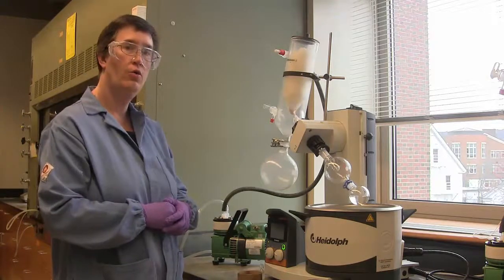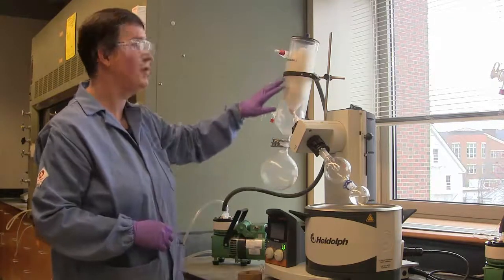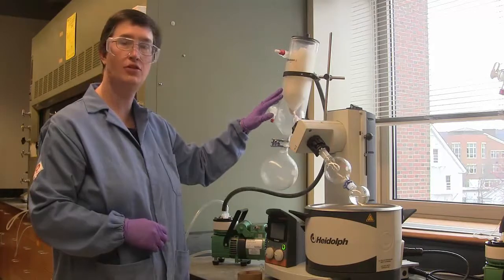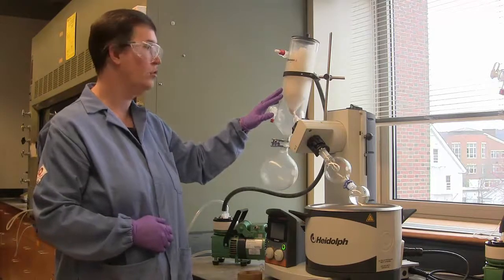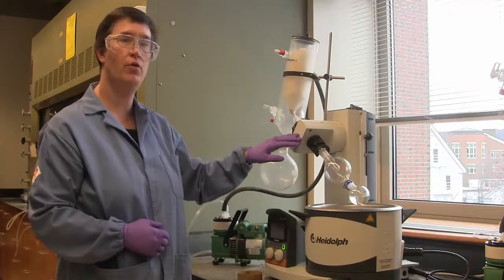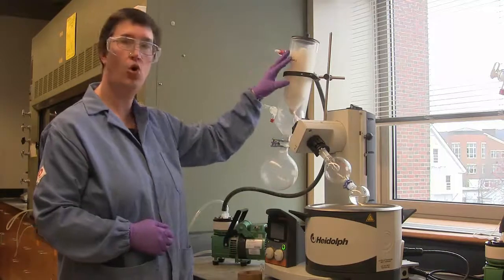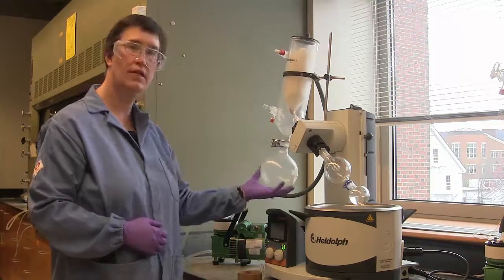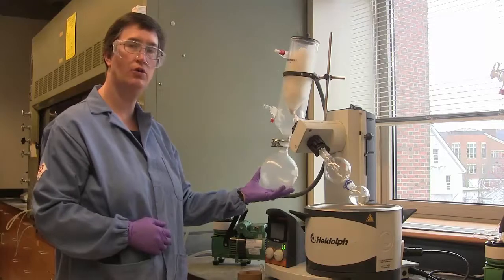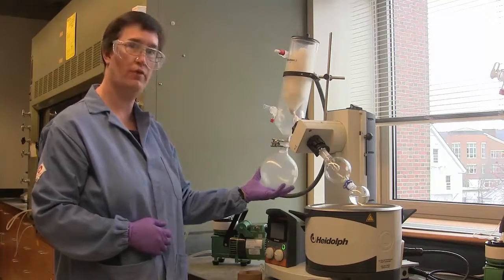Before starting rotary evaporation, I want to make sure that my cold finger is packed to the top with dry ice, so that any evaporating solvent from the rotary evaporator hits the cold condenser, and the distillate collects into the trap on the other side of the rotary evaporator.